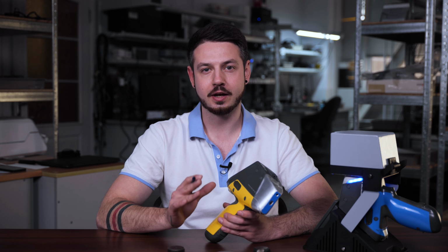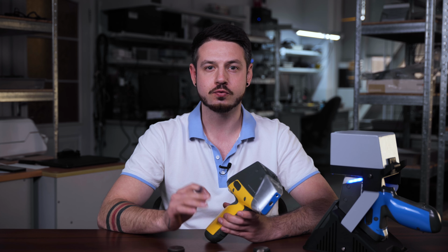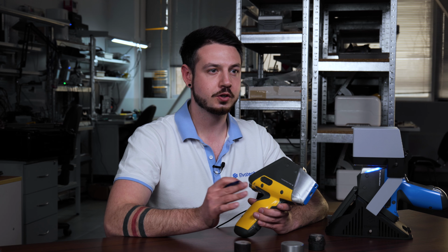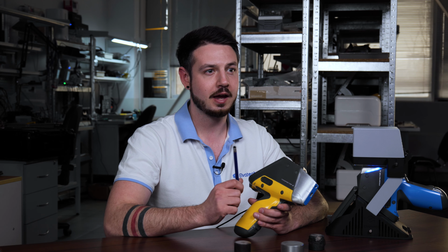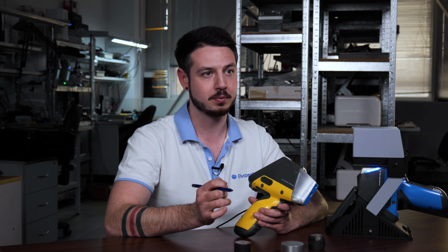To fine-tune the analysis, it is also very important to choose the right collimator. This will help to focus the analysis on the desired area of the sample. The ProSpector 3 has two collimators, standard for 8.5 mm and smaller for analyzing small items. The choice depends on the size and shape of your sample.